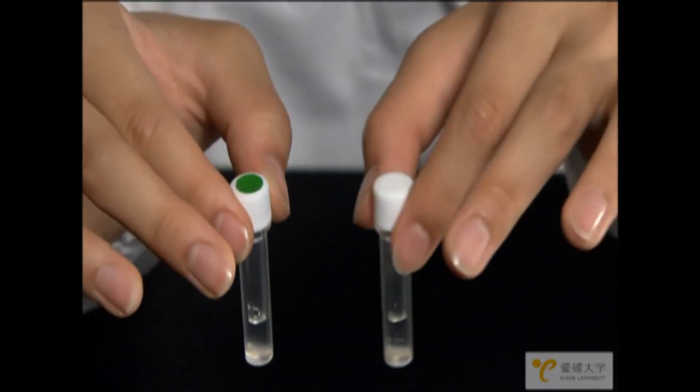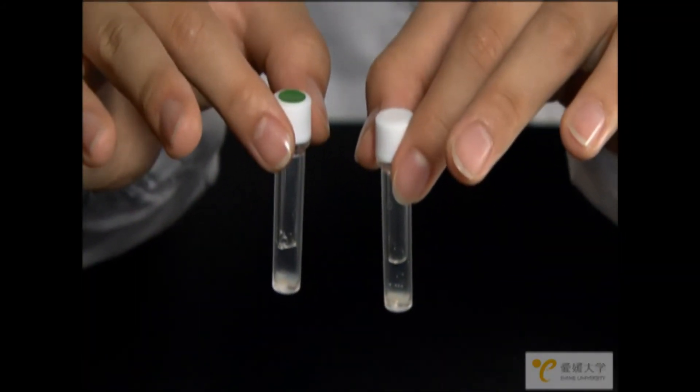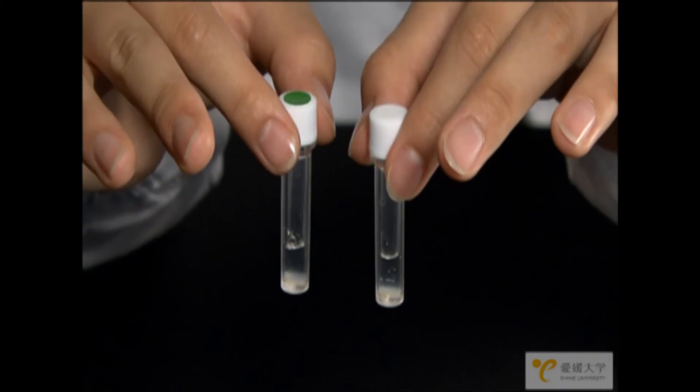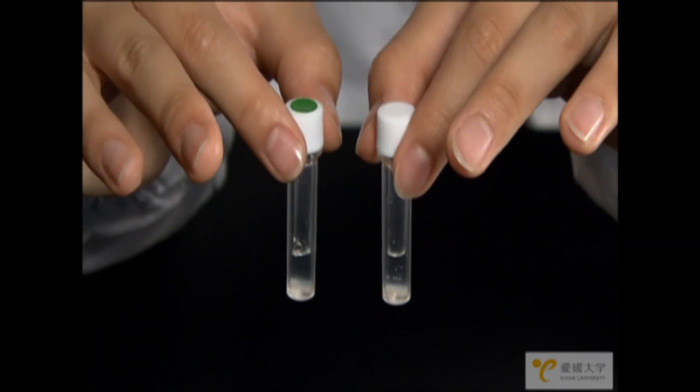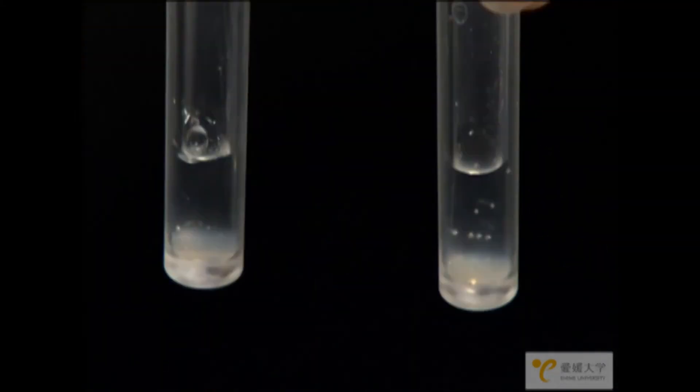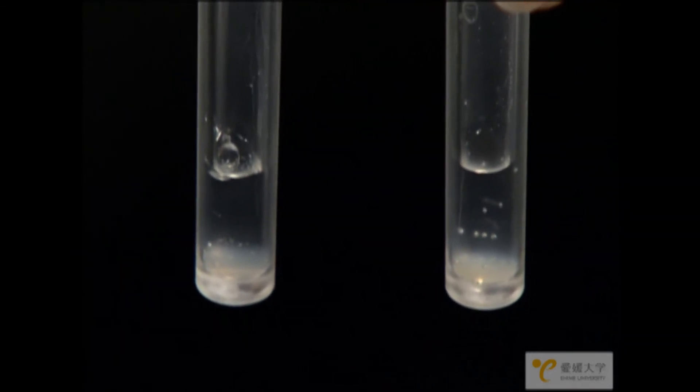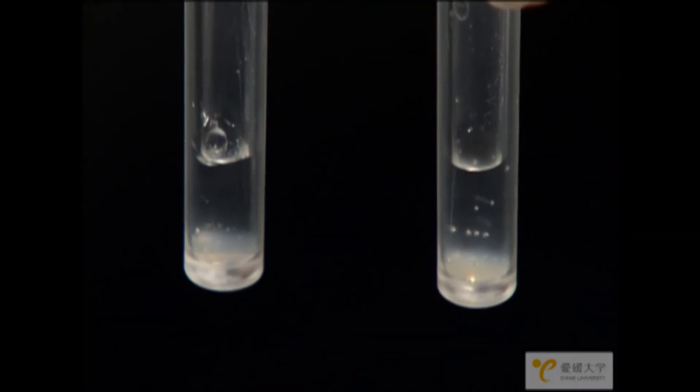You have completed the same procedures for two experiments. One with the tubes with no dot on the cap and one using the tubes with the green dots. However, the results will be different.